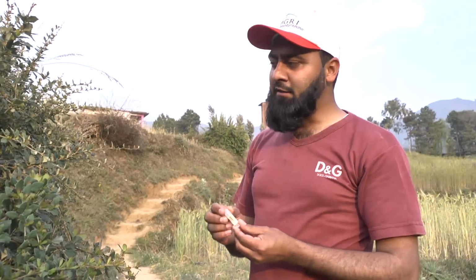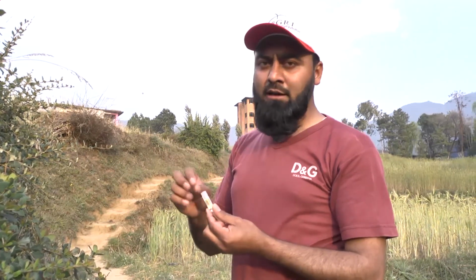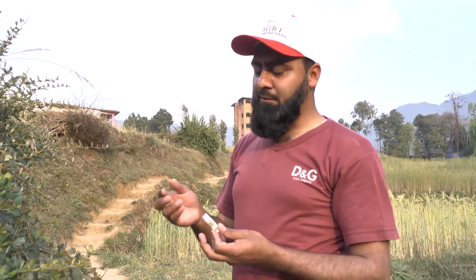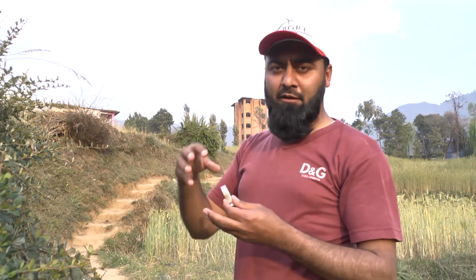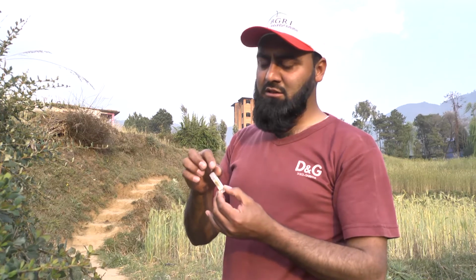Another important point is that in one cryo tube you try to put only one aecial cluster, because two aecial clusters on the same leaf could be different genotypes. So we would like to have only a single aecial cluster. It's not like the living sample, where you would like to have everything, and then in the greenhouse and in the lab you would like to have all the infection and do monospore culturing. In this case we would like to have a single cluster and then do the further sequencing.